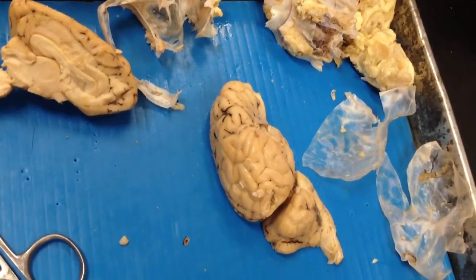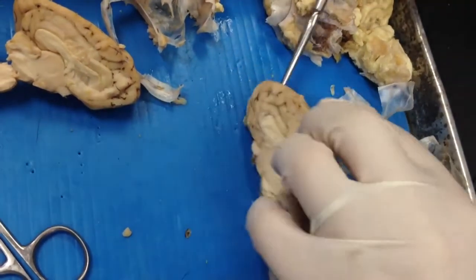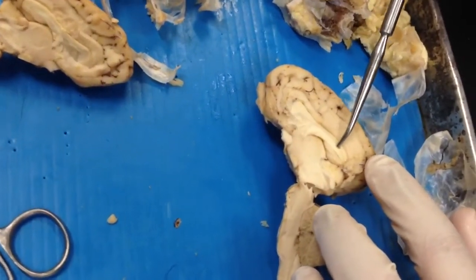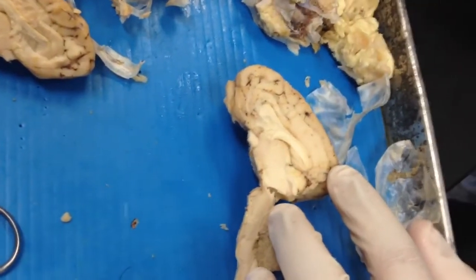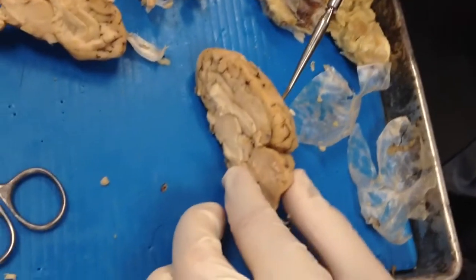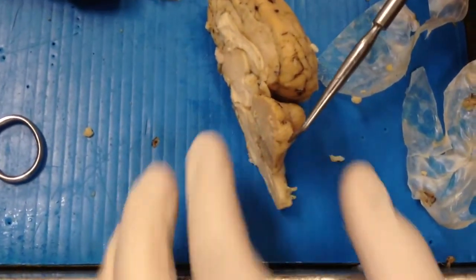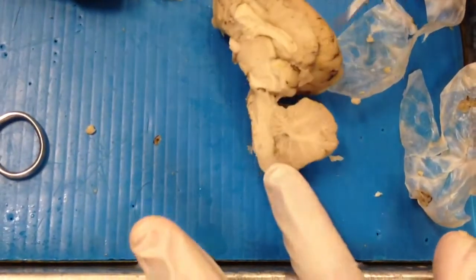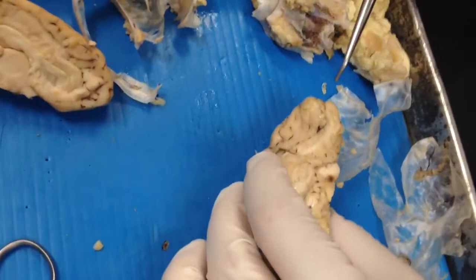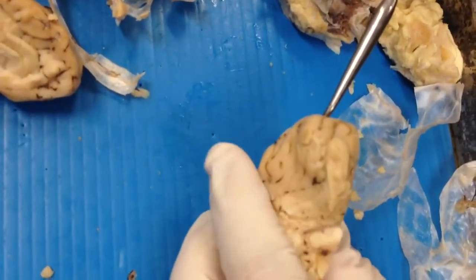Corpus callosum. The vermis. Olfactory bulbs.